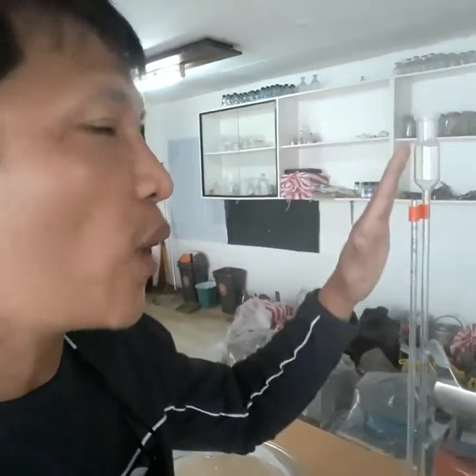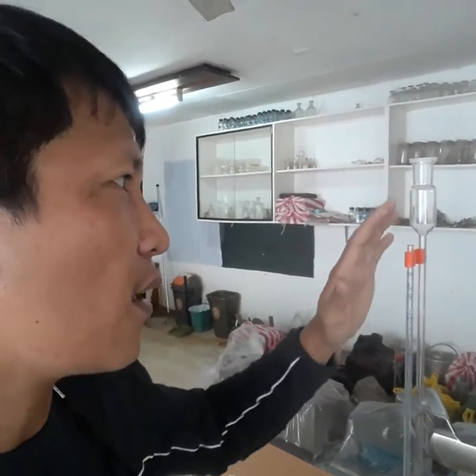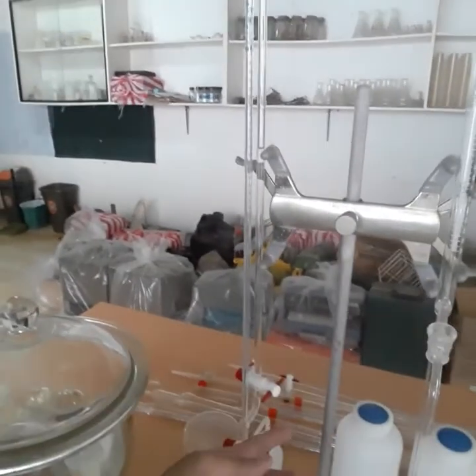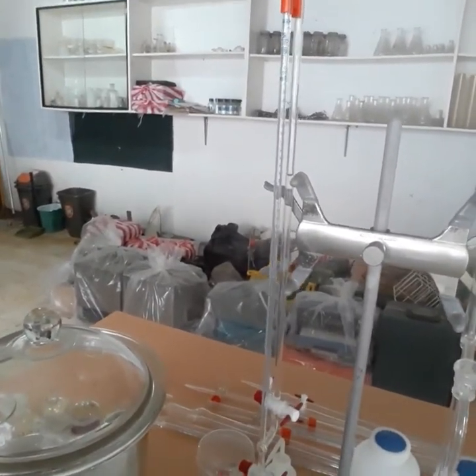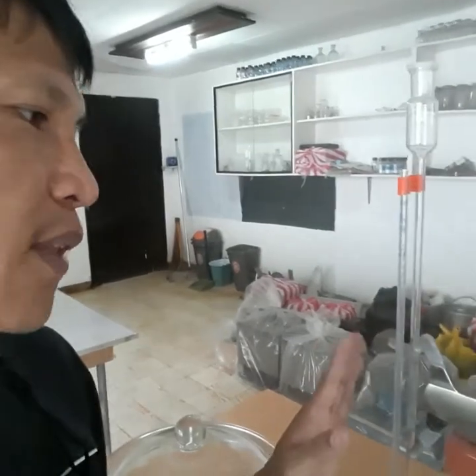So again, when I'm talking about micro, this one can hold as much as 0.1 ml, and still it can deliver and measure, meaning it can give. Whatever you put inside this buret, you can see the volume right away as you fill it and then release it. The stopcock over this part controls it, and you will put anything, usually a solution or a solvent, in this buret. So again, the buret is for measuring.